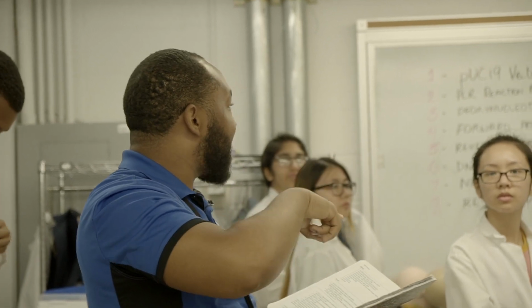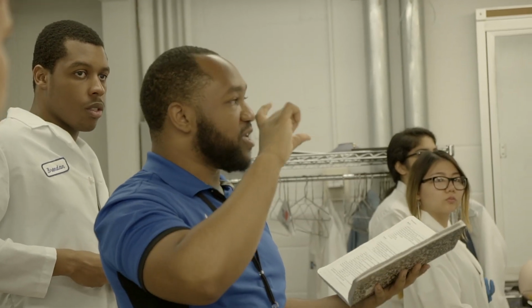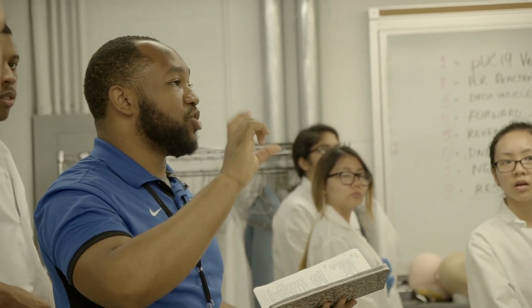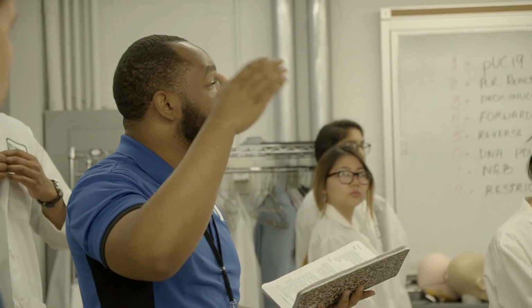Once we've completed that, we will go on to the restriction digest protocol. That should take maybe about 20 to 30 minutes, and then there's some incubation. So the PCR will take about an hour and a half. Restriction digest takes at least an hour. During the restriction digest downtime, we're going to have a short lecture with Rachel. After that is completed, we will go through the final steps of actually running the gel. Okay? If you have any questions at all, please just find one of us and ask, all right?